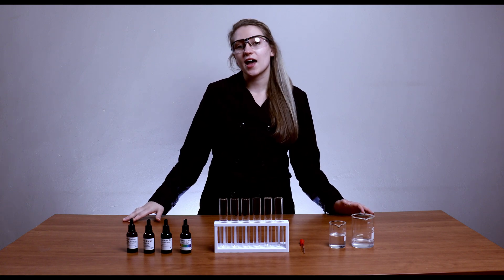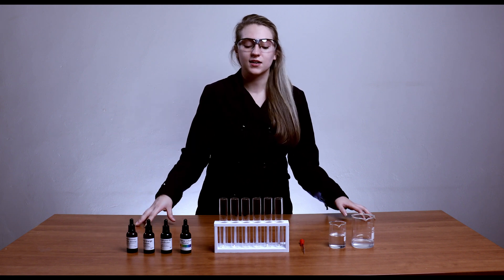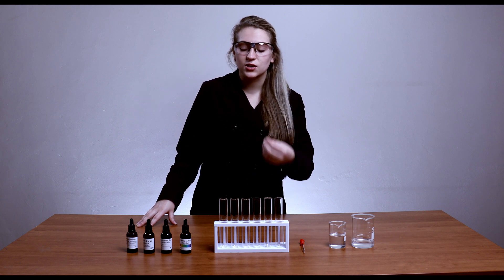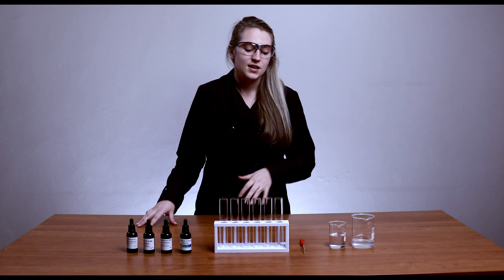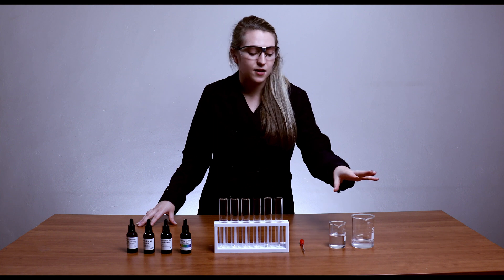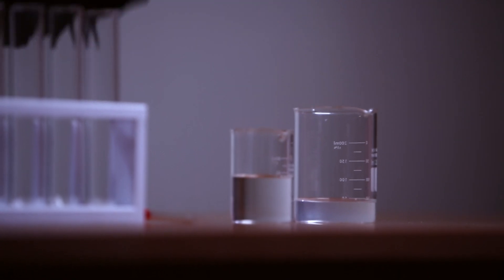Today we're looking at indicators and the different colors that different indicators make within different solutions. We use indicators so that we can see whether a solution is acidic or basic. Today I'm going to work with two weak solutions: a weak acid, which is citric acid, and a weak base, which is sodium hydrogen carbonate.